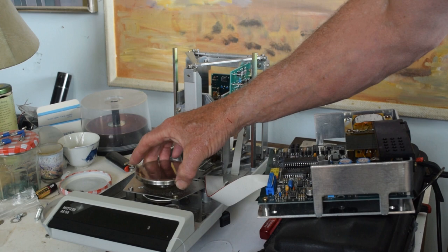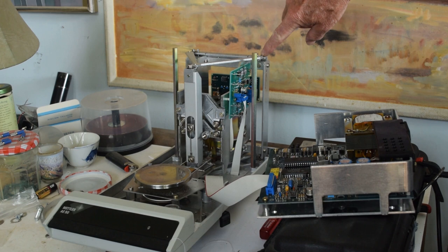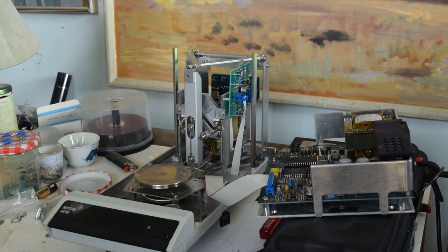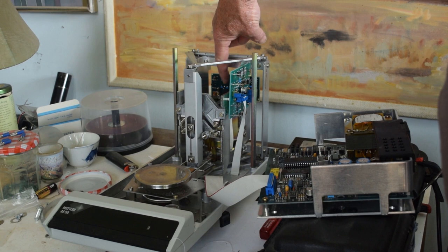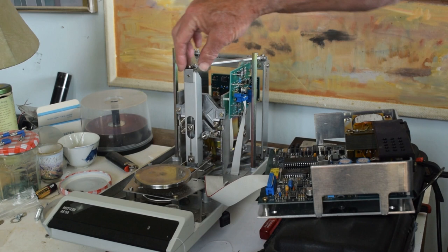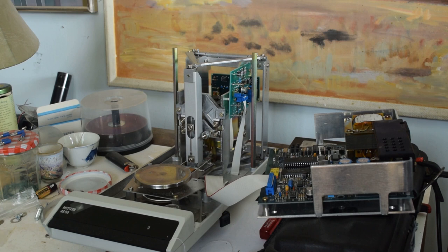You can see what happened: there's a dent right here on the weighing pan. That dent indicates that something heavy was dropped, which bent the mechanism and broke the flexure. Back here I have put together a flexure out of aluminum and put it in place — not particularly scientific, but it was quick and easy. This is the analog board; back here is the slot and vane sensor and its amplifier. The whole thing moves about that far, limited by a screw right here.